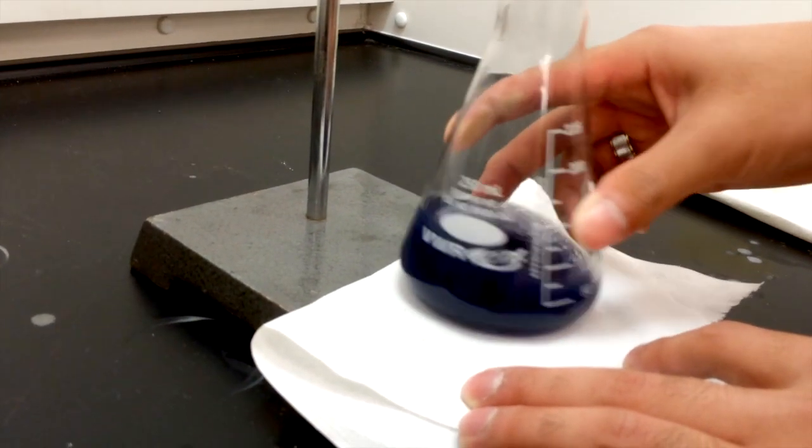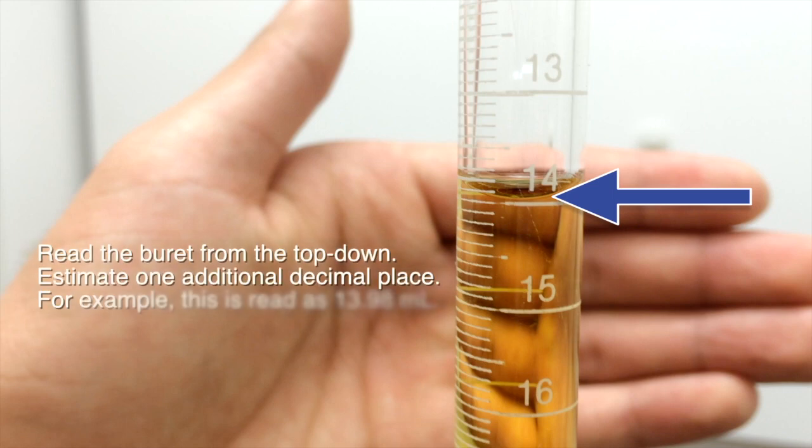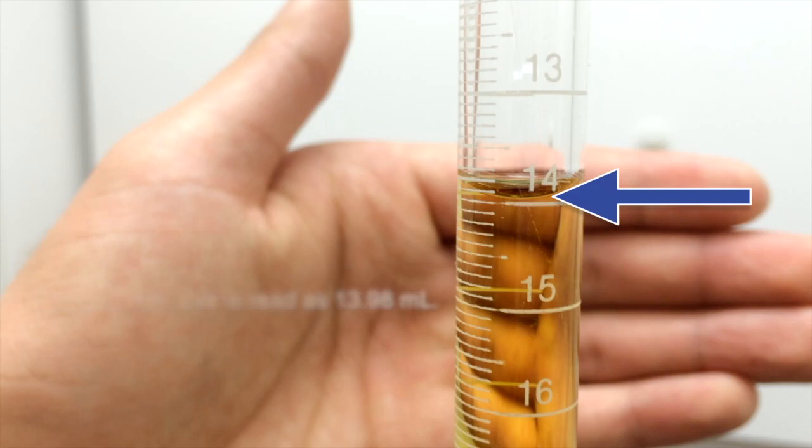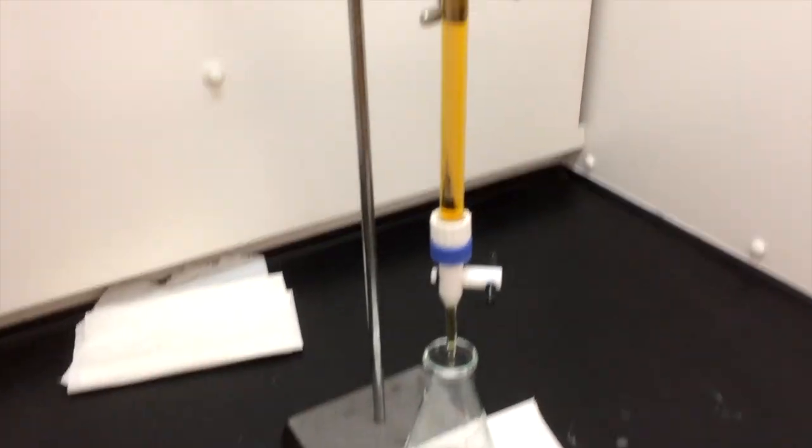Record the volume that you've stopped at. Repeat this with a second sample.